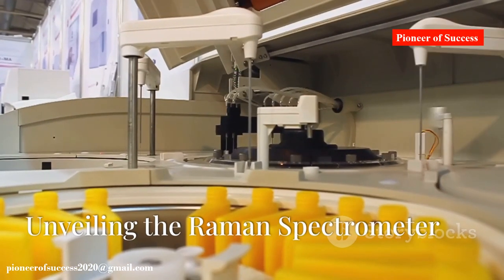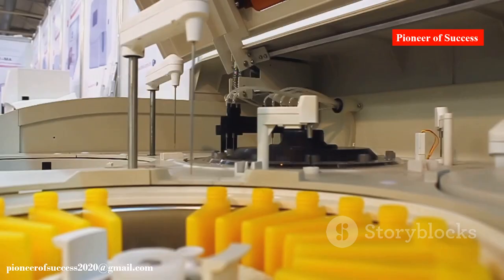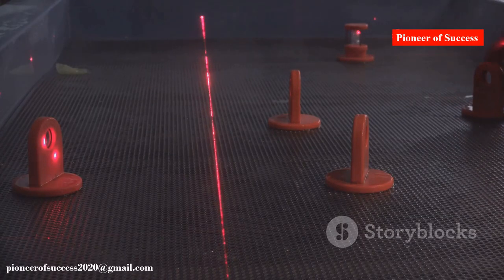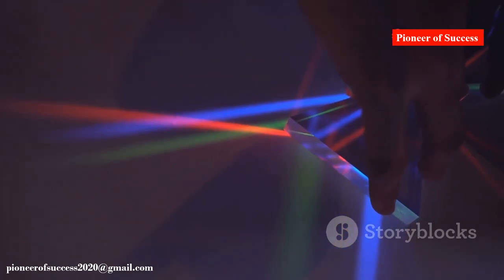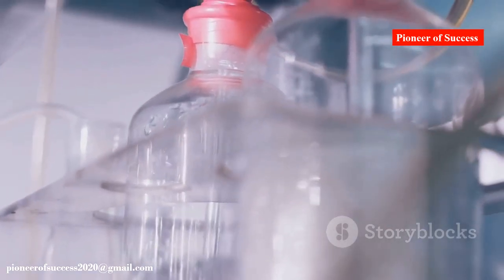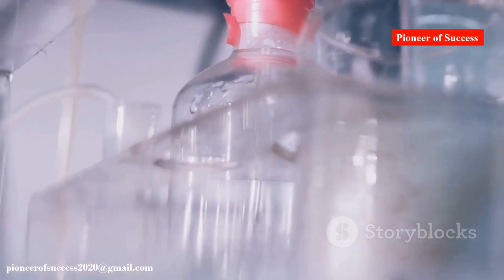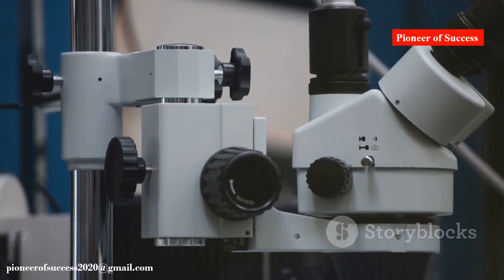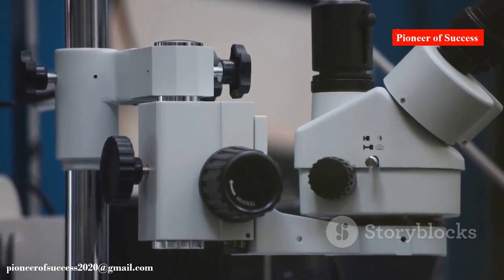Raman spectrometers harness the power of Raman scattering with key components. A laser light source matches the vibrational frequencies of interest, and scattered light is collected and separated by wavelength. A detector converts photons into an electrical signal, generating the Raman spectrum. Modern spectrometers feature confocal microscopy and surface-enhanced Raman spectroscopy for enhanced sensitivity.